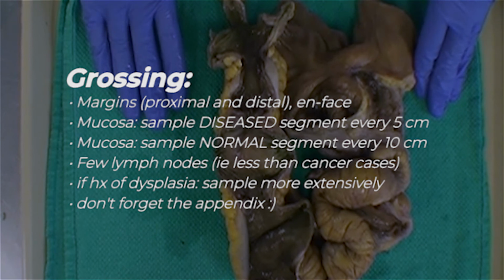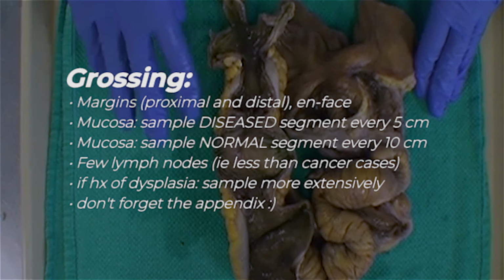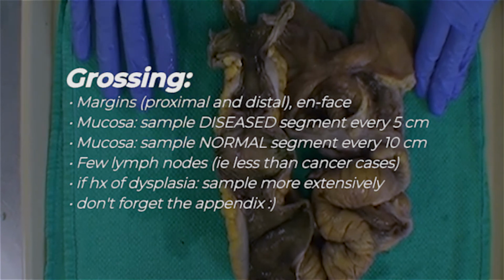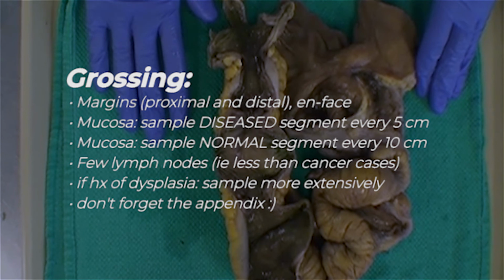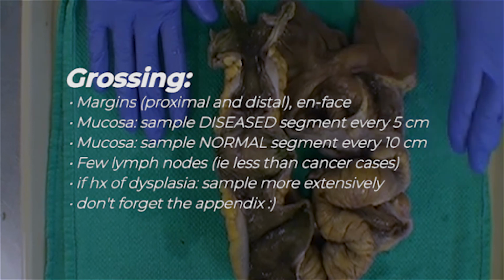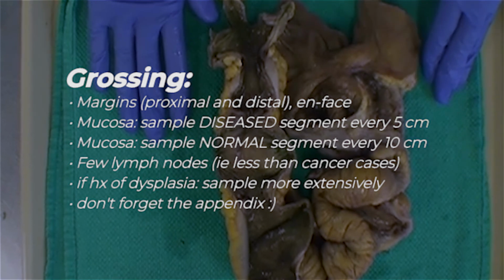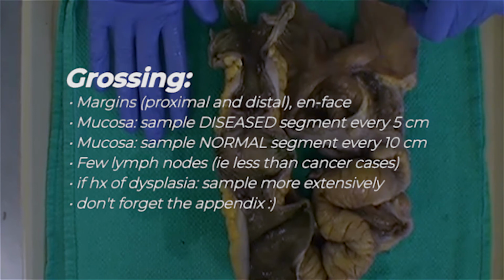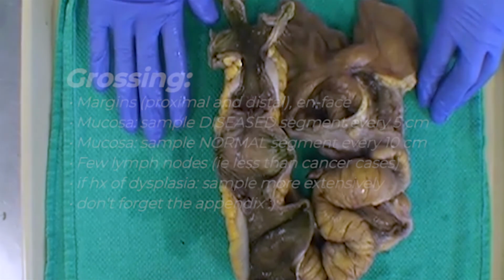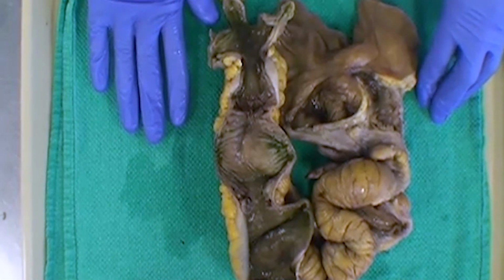Again, key things to keep in mind with a specimen like this is to pay careful attention to the areas of stricturing, to really carefully section those through thinly to make sure there's no occult carcinomas hiding in there. The other structures here that are a little bit unique that we want to make sure we sample well are the IC valve across the small bowel and the large bowel, as well as our appendix, as we would in the previous specimen as well. And so we're going to submit our sections for microscopic evaluation.